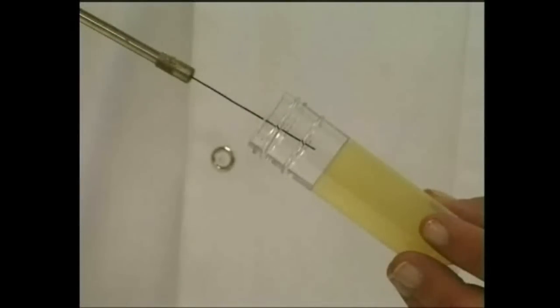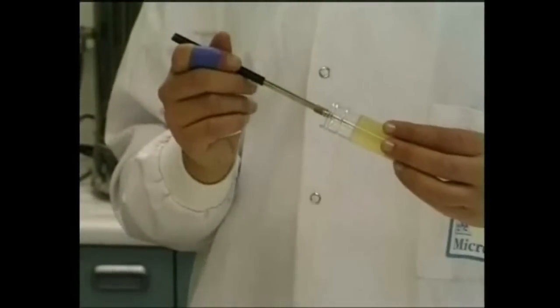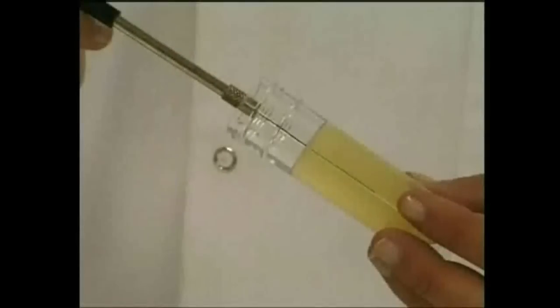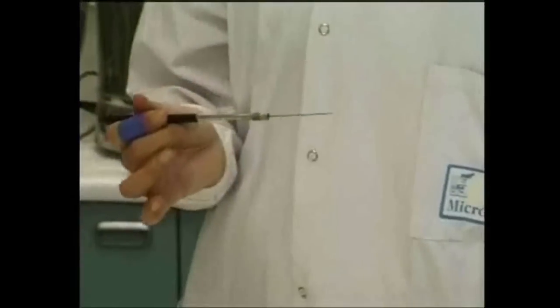With stabs, the medium is inoculated with a straight wire instead of a loop. Other than that, the procedure is identical to that used for the slopes. The stab bottle is opened, the neck flamed, and the medium inoculated by pushing the wire smoothly into it to a depth of 3 to 4 centimeters. The bottle should then be reflamed, the top replaced, and the wire flamed to sterilize it.